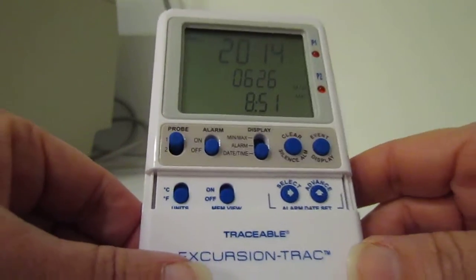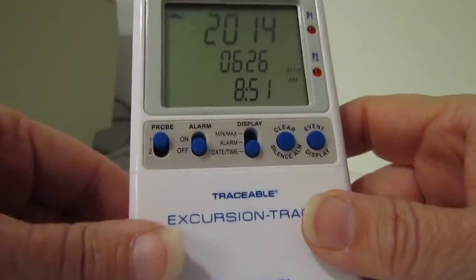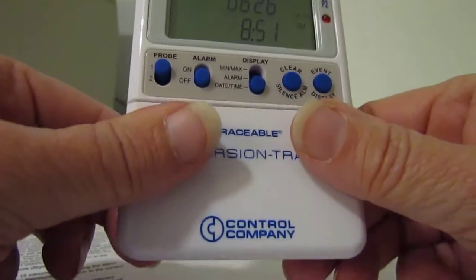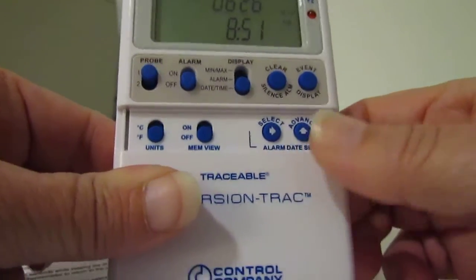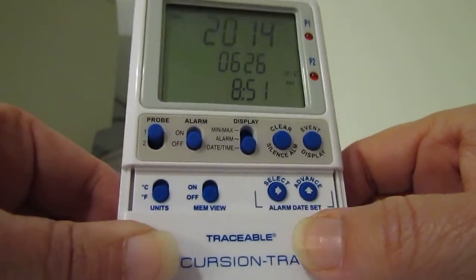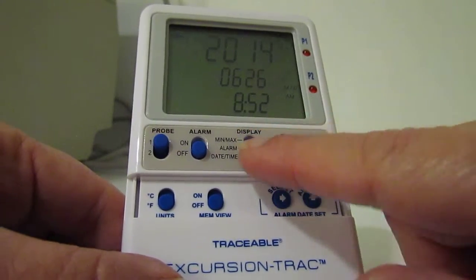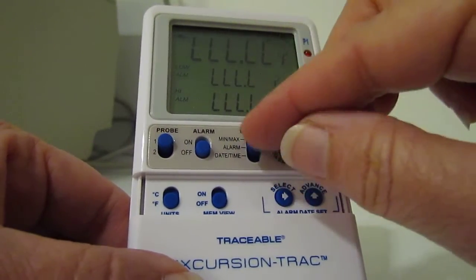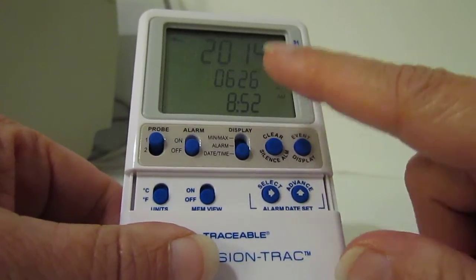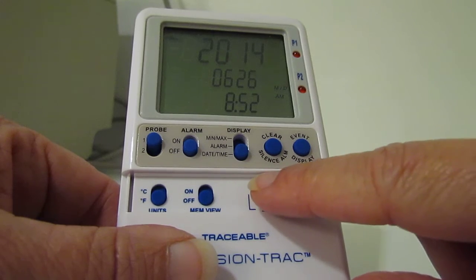This snippet of video is about setting the date and time on your unit. The first thing you need to do is slide this part down to the little section so you can get to the select button. Make sure that the display button is all the way down on date time, and then press the select button.